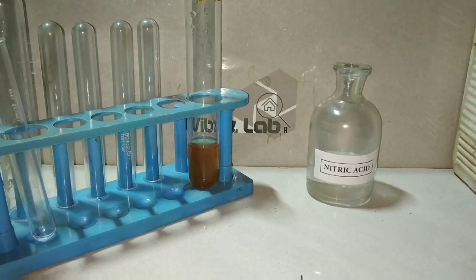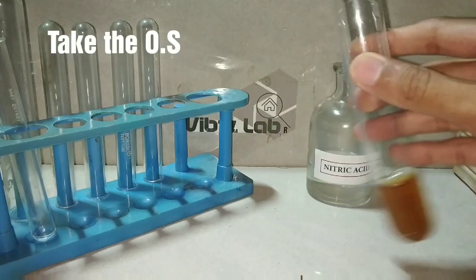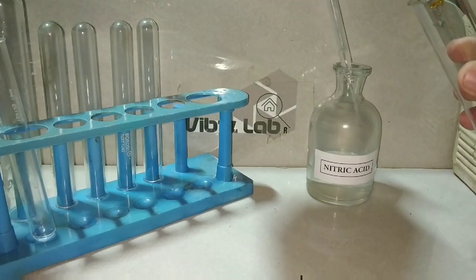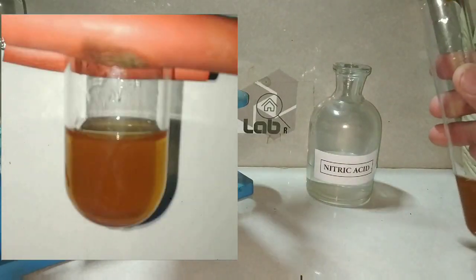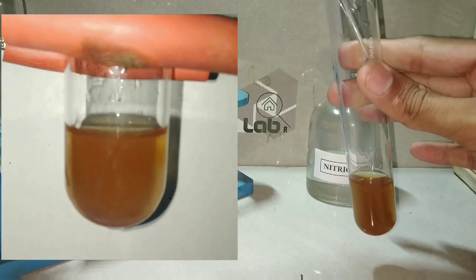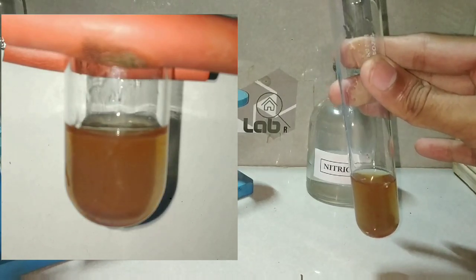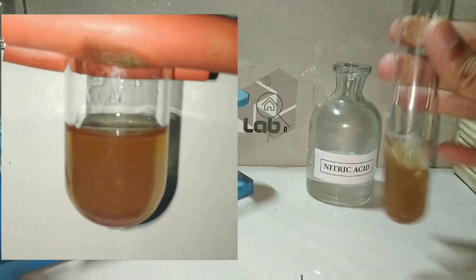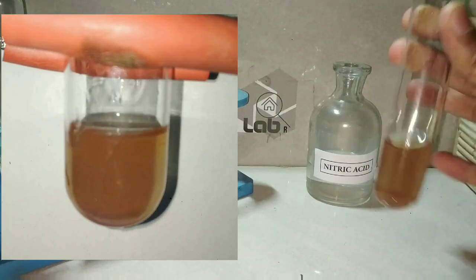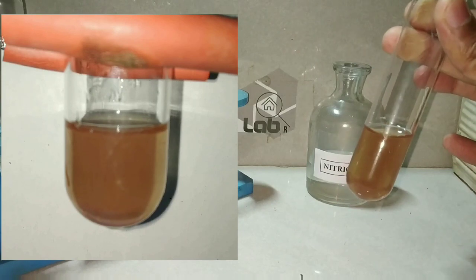Even though it is said to be ferric ions, sometimes there may be ferrous ions, so we will oxidize it with concentrated nitric acid so that all the ferrous ions are converted to ferric ions. Nitric acid is a very good oxidizing agent and it converts all the Fe2+ to Fe3+.